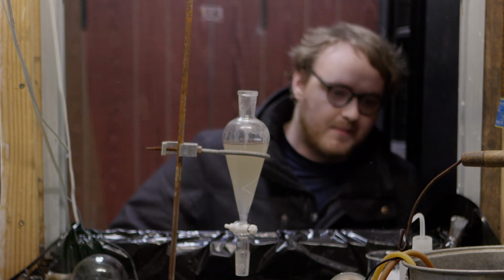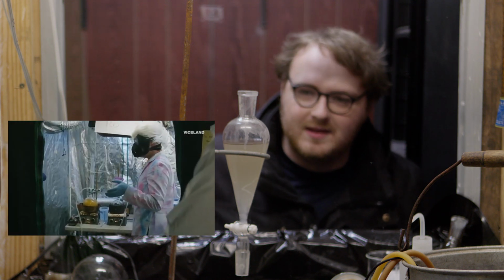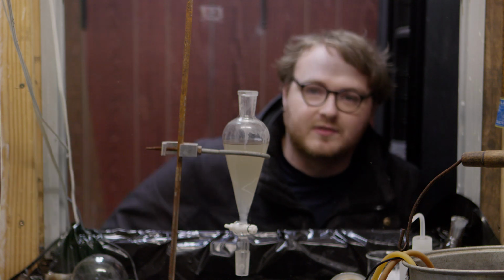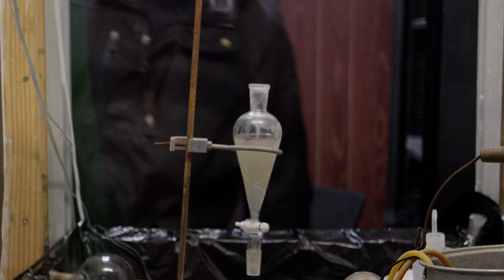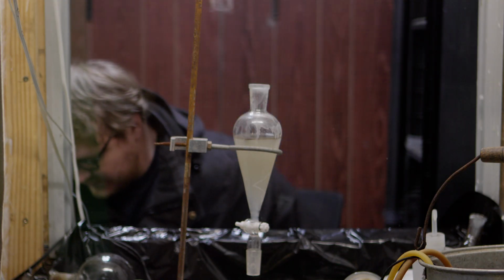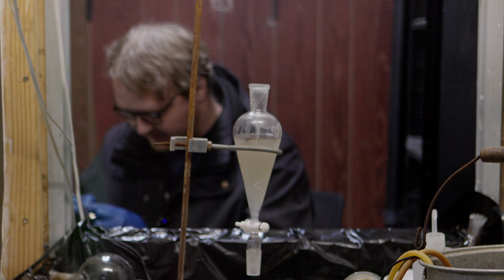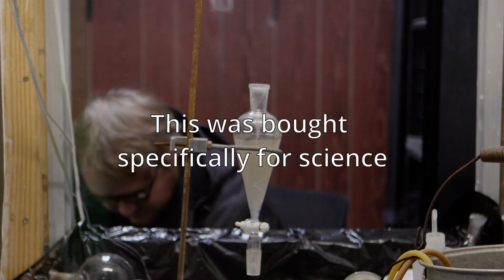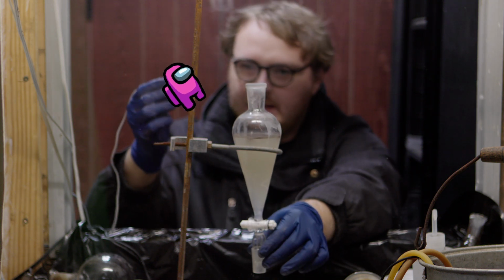Now, I didn't want to do this, but there's this particularly cursed episode of Hamilton Morris where he meets some drug chemist and he has a solution for dealing with emulsions like this. An emulsion is broken with a vibrating apparatus. So I mean, this is the right spot. Okay, let's see if we can get this wired up. We're wiring this into a power supply because I don't want to run this on batteries all day. Okay, we're gonna have to censor this. This may be a little too hot for YouTube, but yeah.